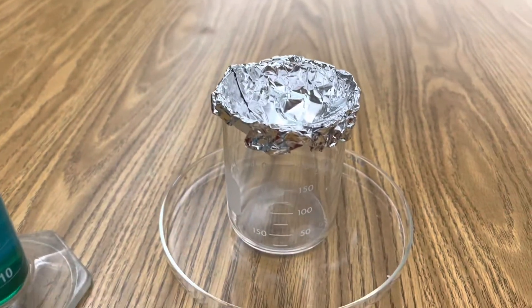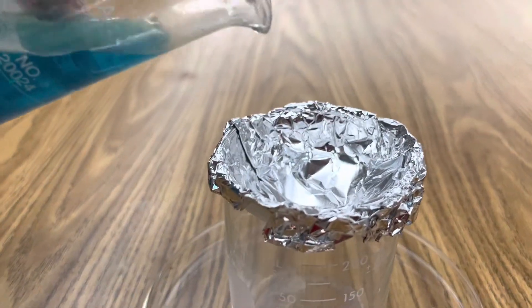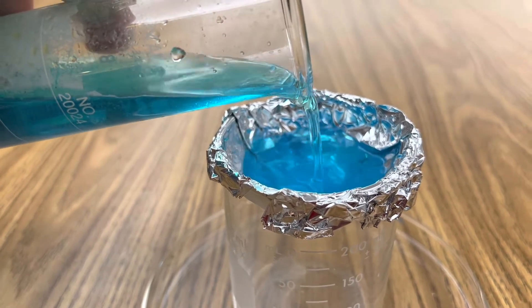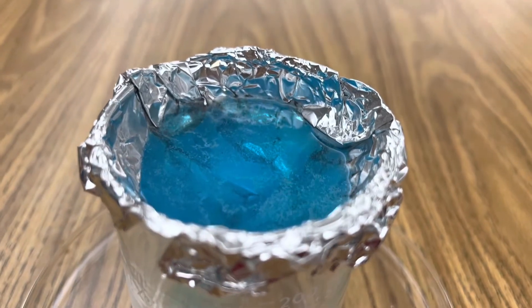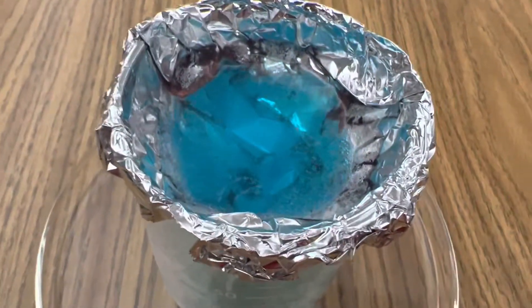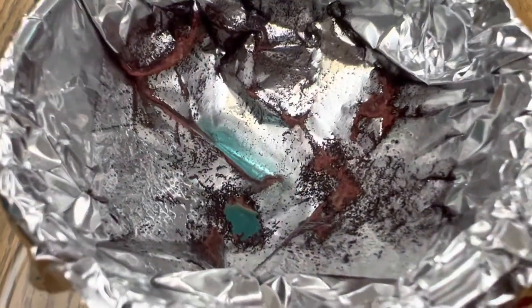Now you're ready to pour a little bit of your concentrated solution of copper chloride over the aluminum foil to observe the reaction. Here we go. At first nothing's going to happen because there's an oxide layer covering the aluminum foil, but pretty quickly you'll start to see bubbles, and that's when it starts to break through that oxide layer and you'll see that there's copper that appears on the aluminum foil.